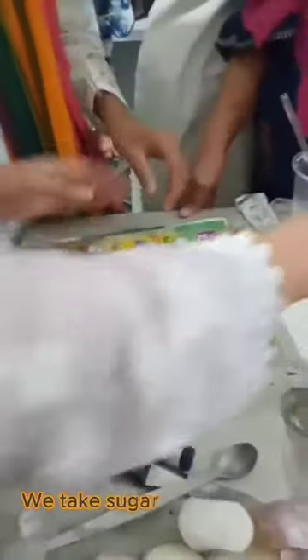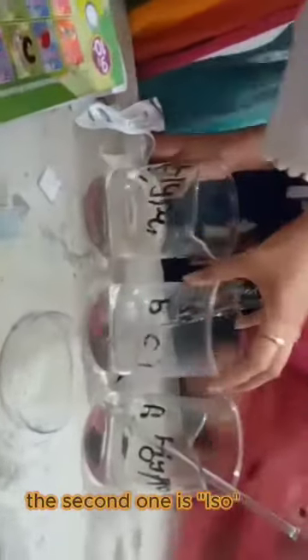we take sugar solution A, B, and C. The first one is hypo, the second one is iso, and third one is hyper. Add solution A on slide A.